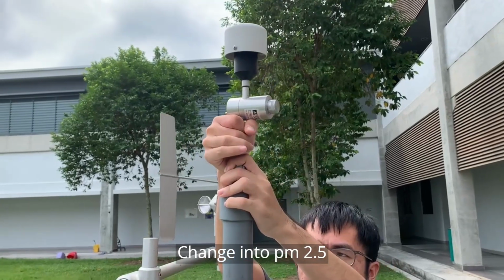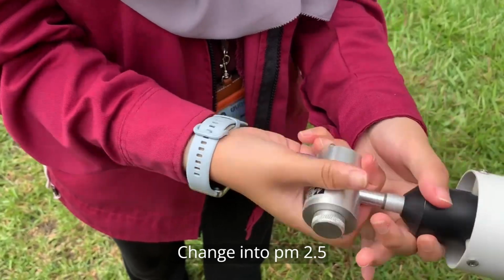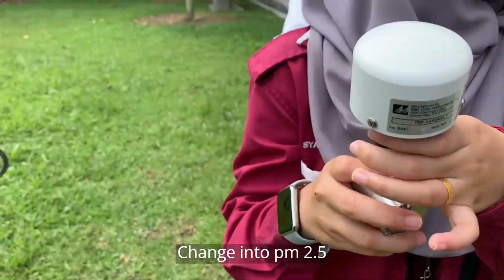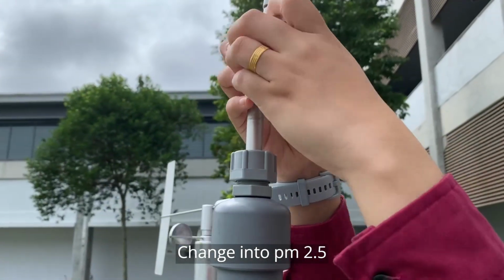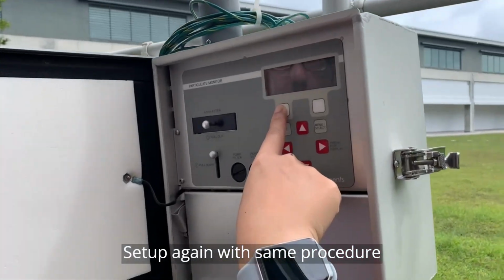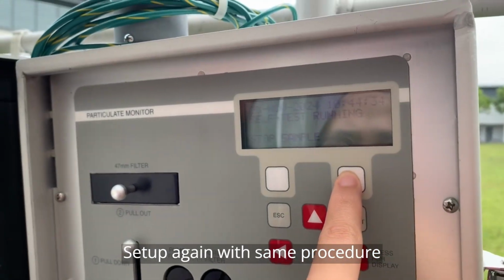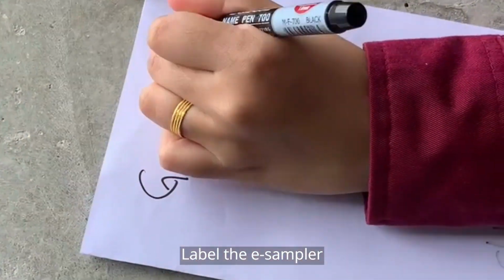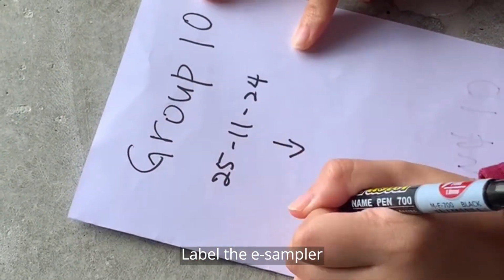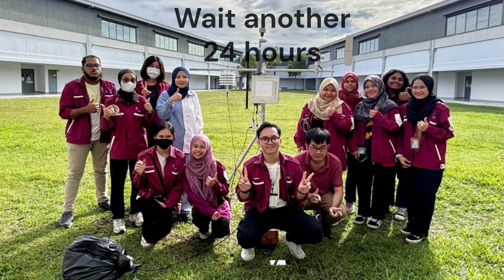Proceed to the next experiment by changing the PM10 cap to PM2.5 for the next process. Attach the TSP cap on the e-sampler device. Make sure to connect them properly. The experiment setup process was repeated with the same procedure as PM10. Then label again with new information for the experiment. Then wait again until the next day to record the data.